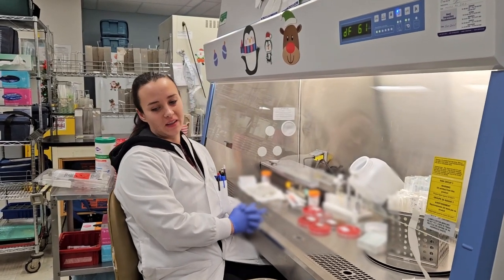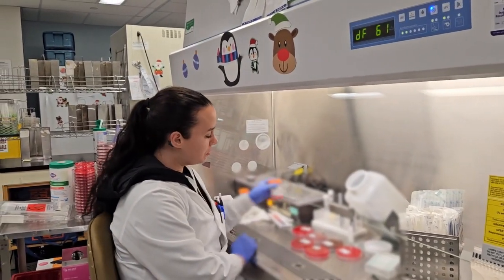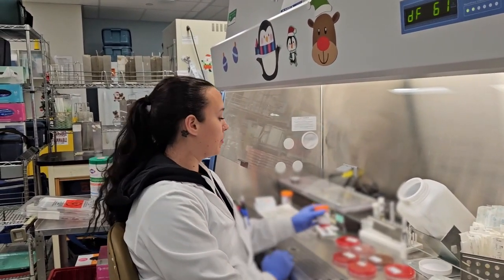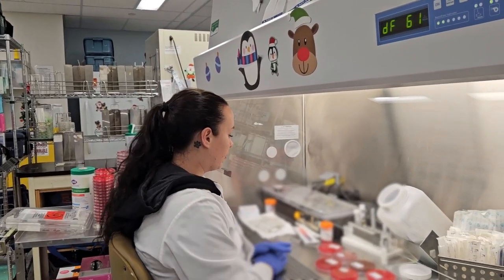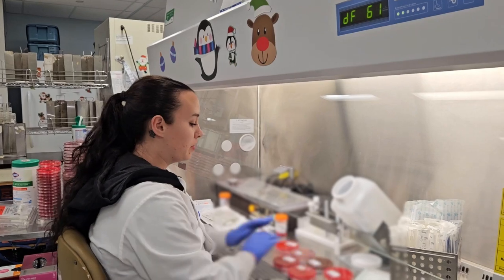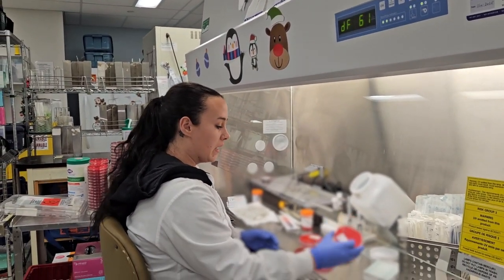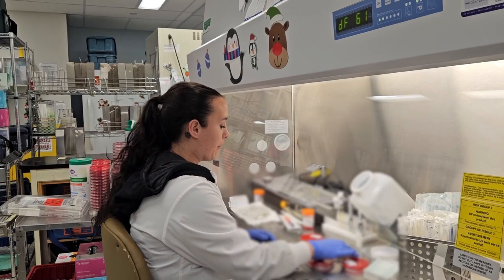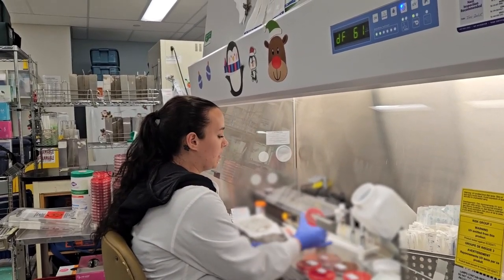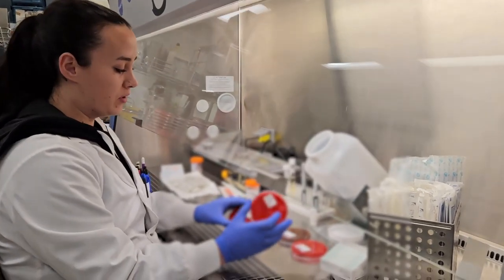I'm one of the MLAs here in the microbiology lab. We just received a tissue sample here, so I'm going to show you how we process that. First, I get all my supplies ready. We do a bunch of different plates for tissue because it's a sterile specimen. We have blood, chocolate, MacConkey, CNA, and our two anaerobic plates, which is Brucella and Brucella Neo.